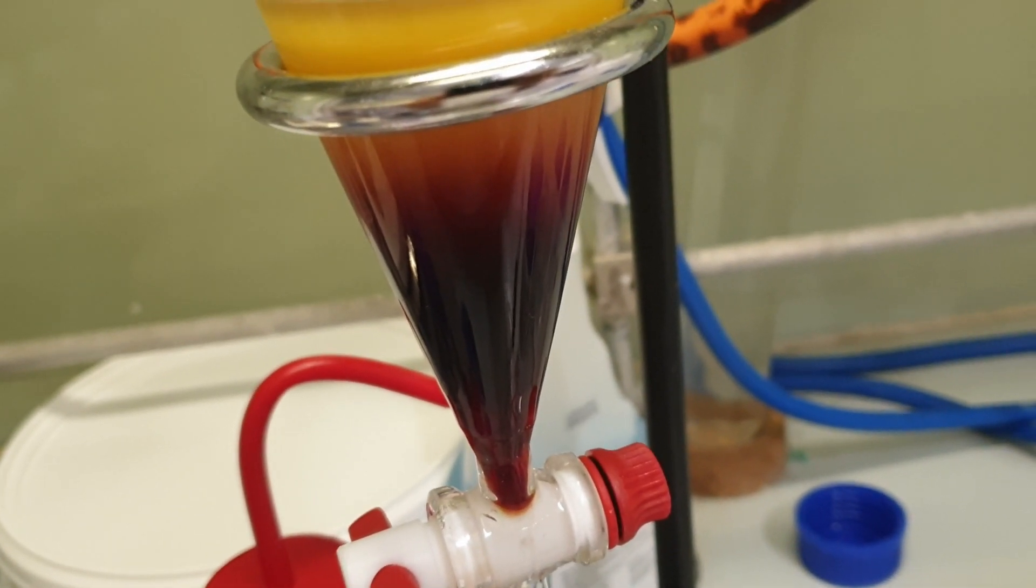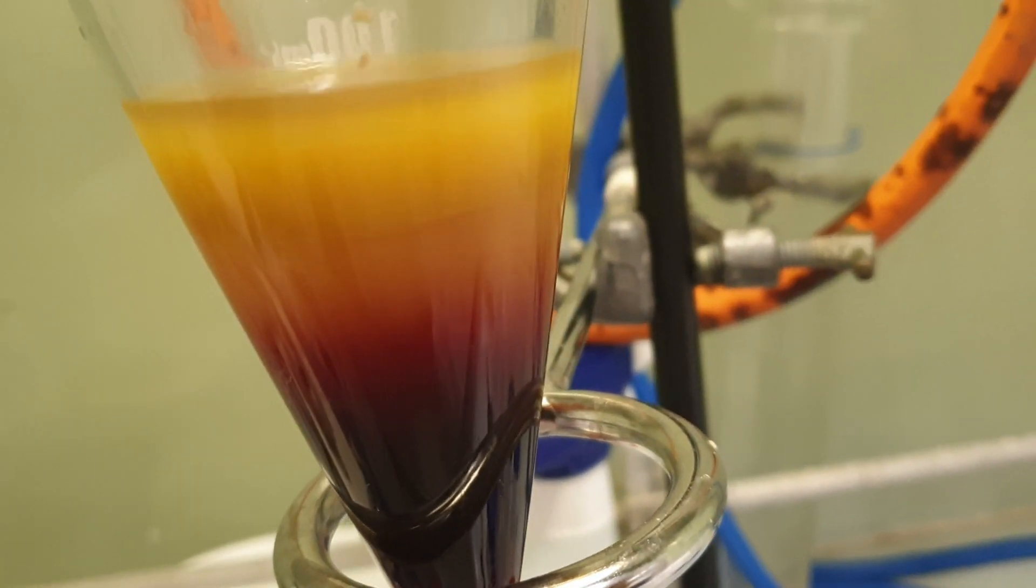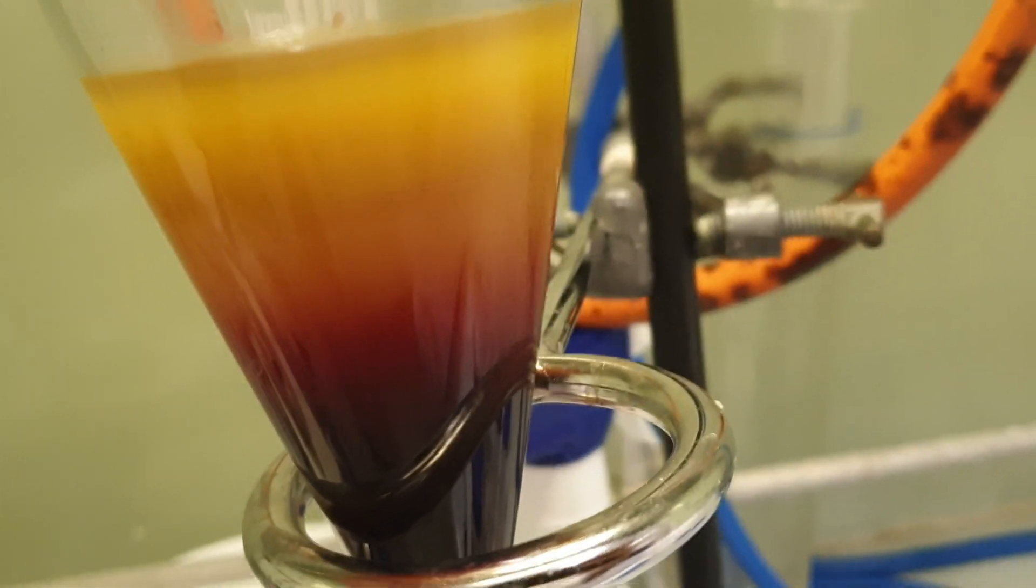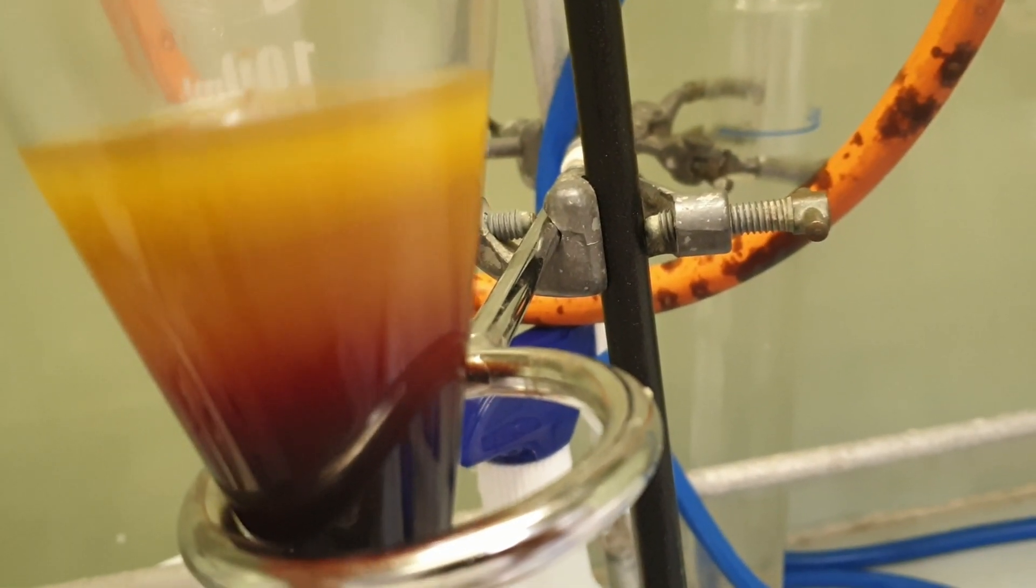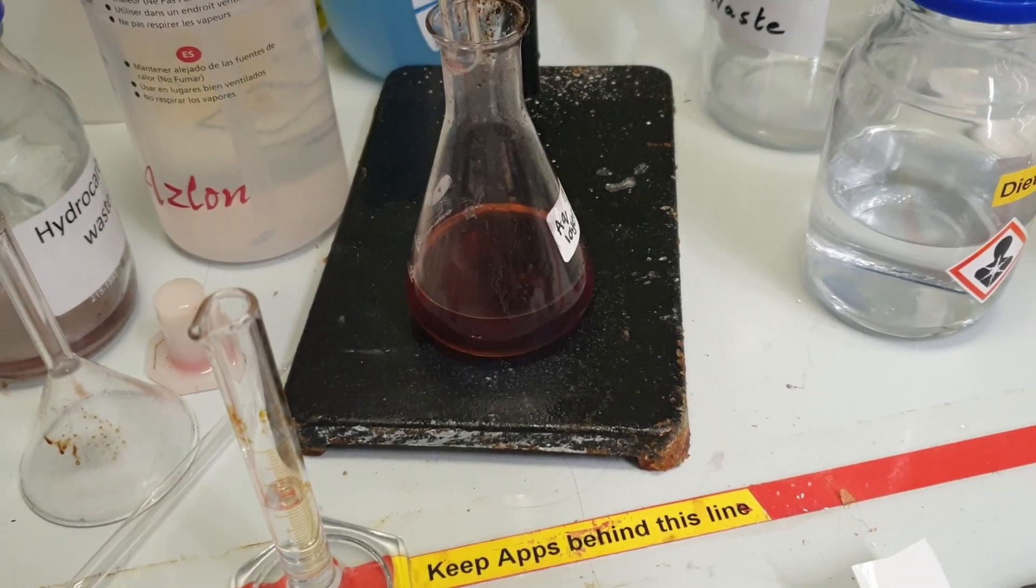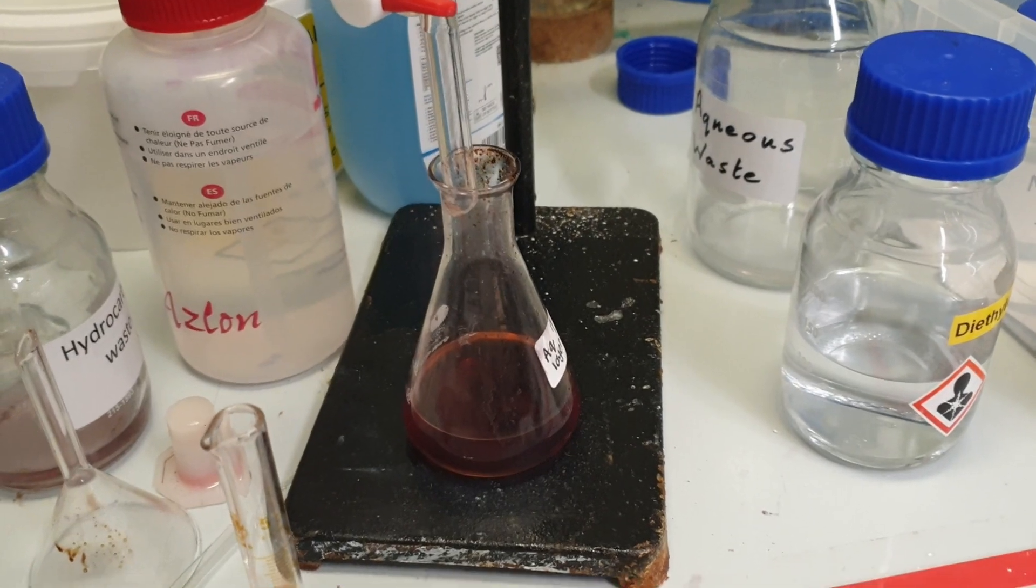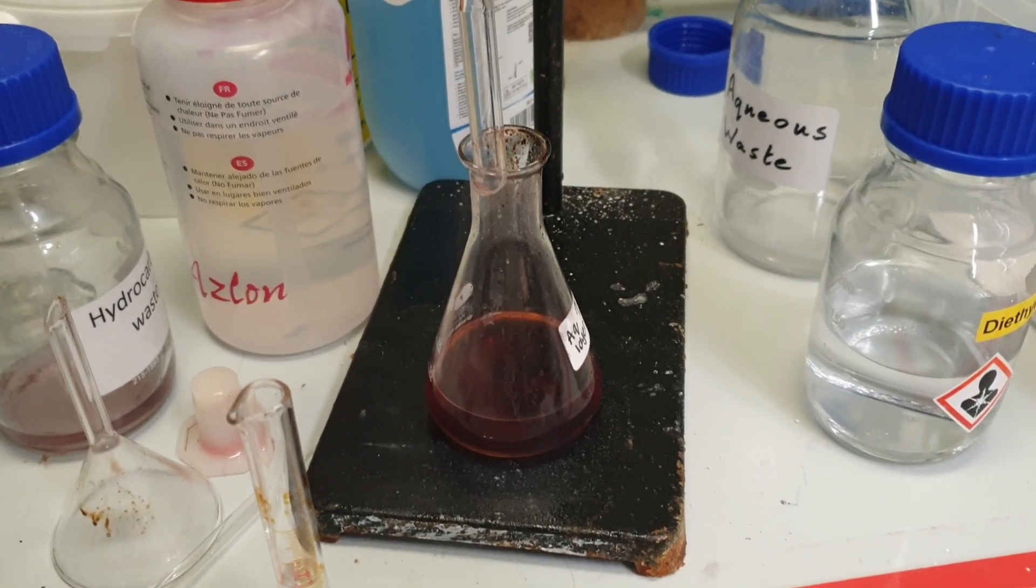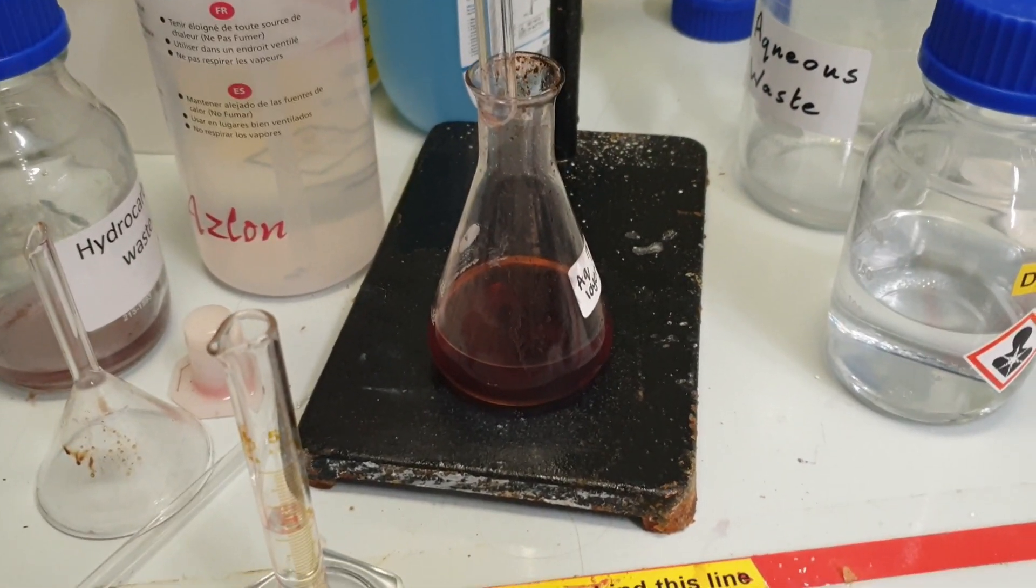It also would have prevented it going this dark color which we will discuss shortly. In this clip I also remarked that the water dissolves the dark stuff. I don't think it really dissolves the dark stuff, I think it's just because the dark stuff's more dense and viscous. It just sinks to the bottom. Instead of restarting I decided to try and salvage what I had. As it turns out this was not salvageable.